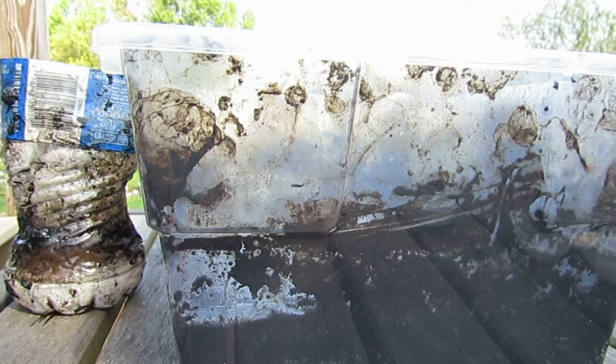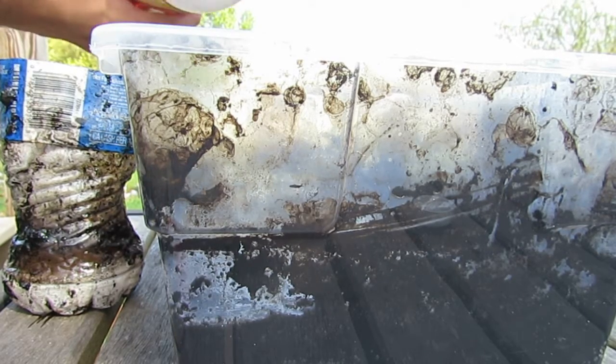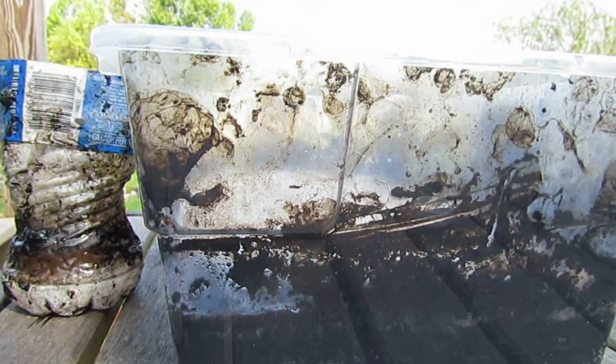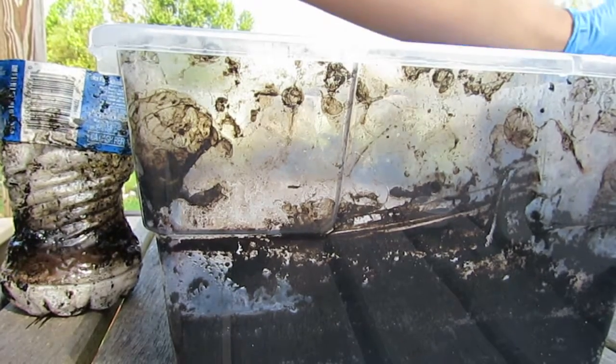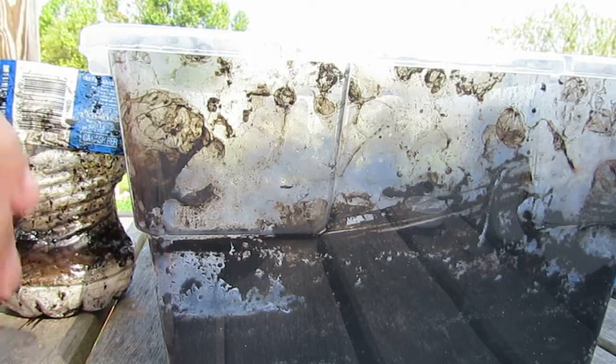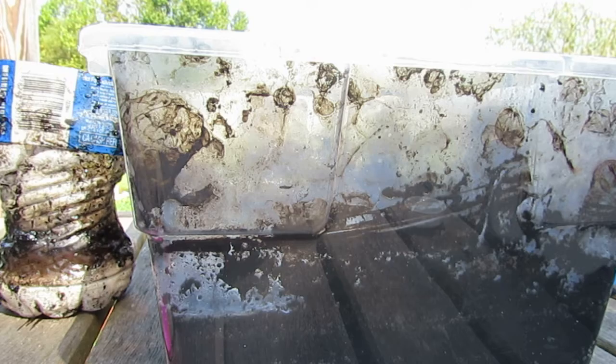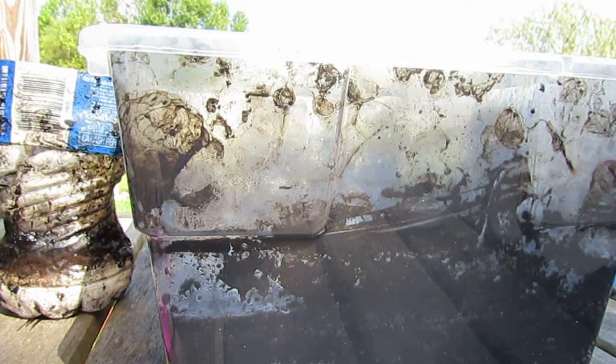The reason why I'm using distilled water and not tap water is because distilled water doesn't add anything to the solution except water. I might move because this sun is too hot.